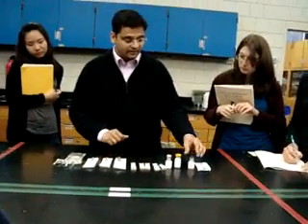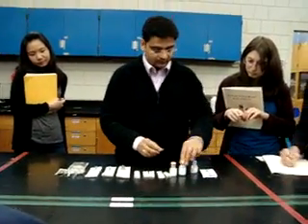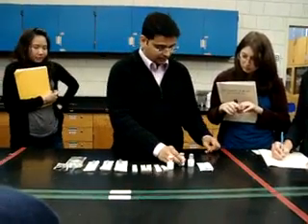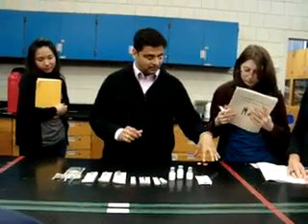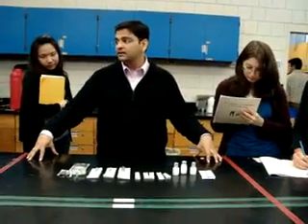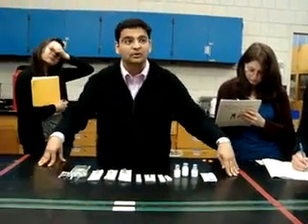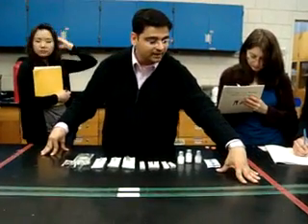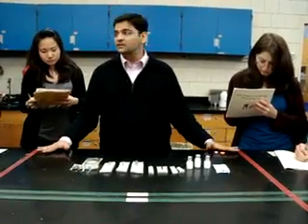You say yes, and the examiner is going to time you — it is 10 minutes. One more thing: the garbage should be on either this end or that end, not in the front. If you keep it in front, you are going to block the airflow. The garbage should go in this corner.